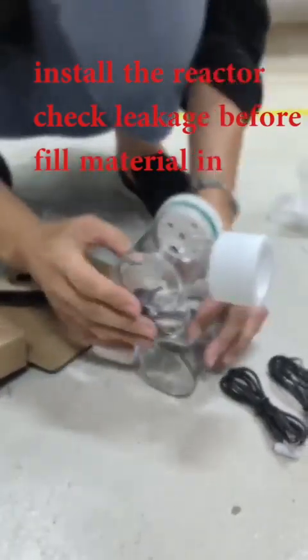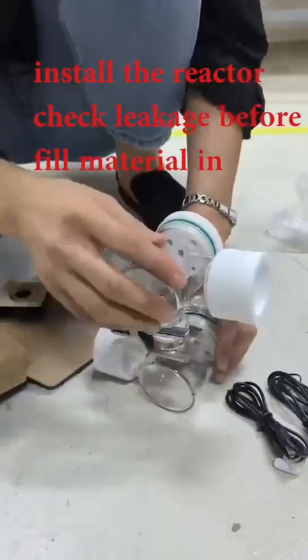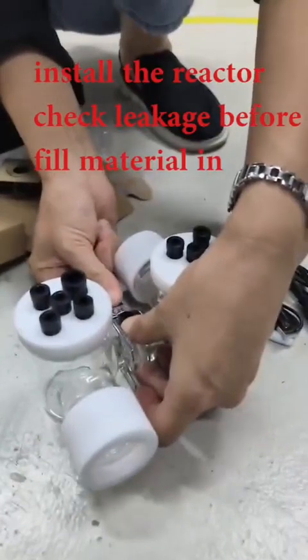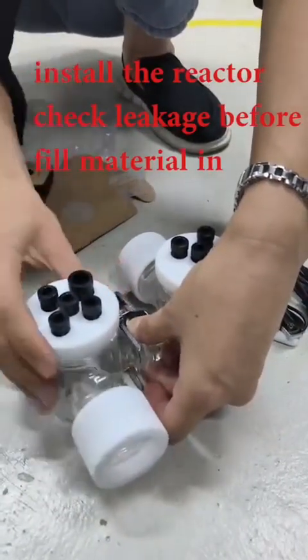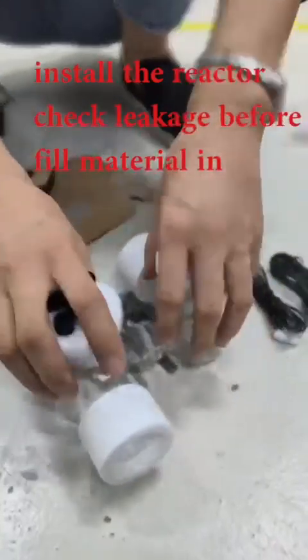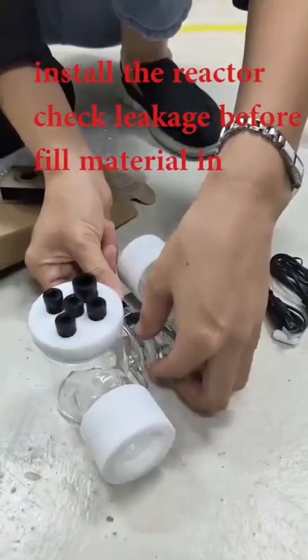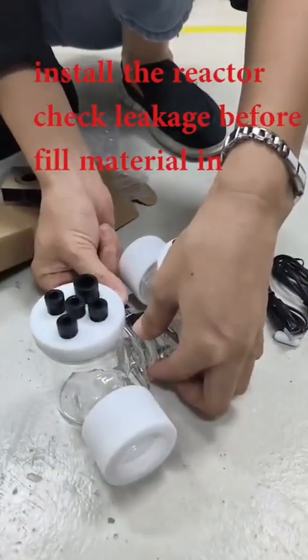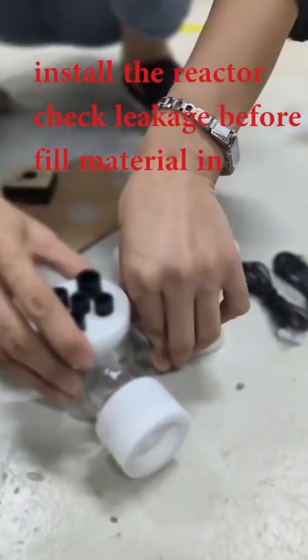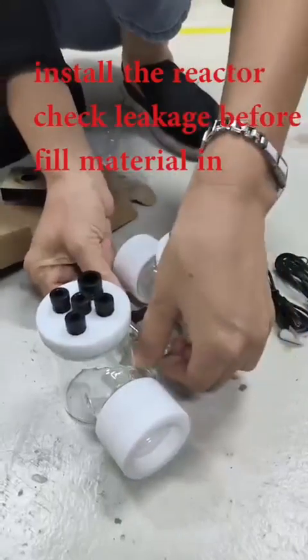Before you lock it down, pay attention to the flat part here and make sure it's flat. If it's not flat, you can release here a little bit and adjust it. When it's very tight, you cannot adjust the angle anymore. It may crack. So adjust this before you tighten. Then you can slightly adjust the membrane. Then after you finish, you can tighten it.